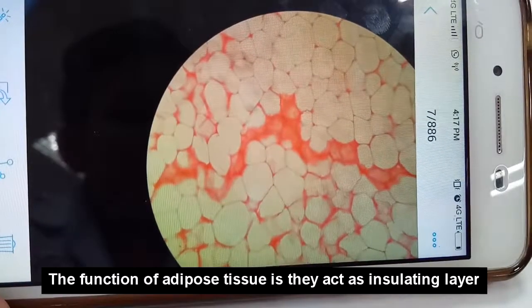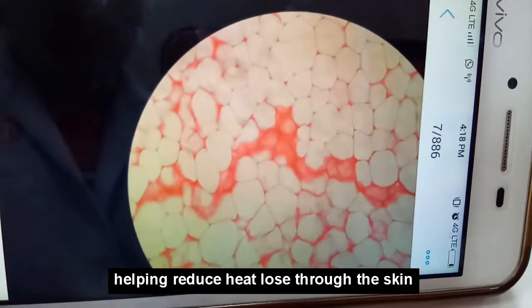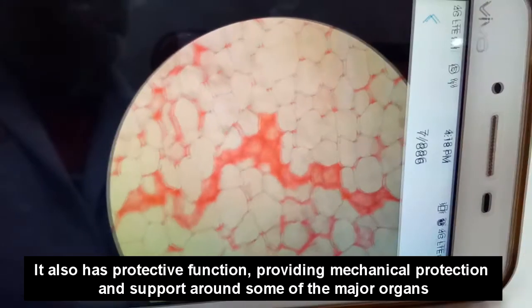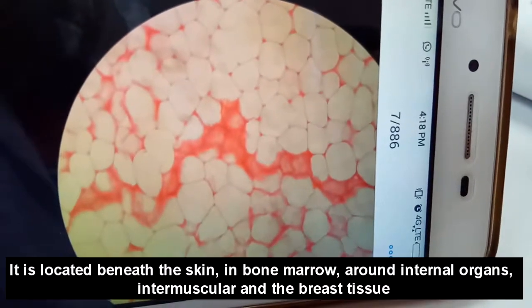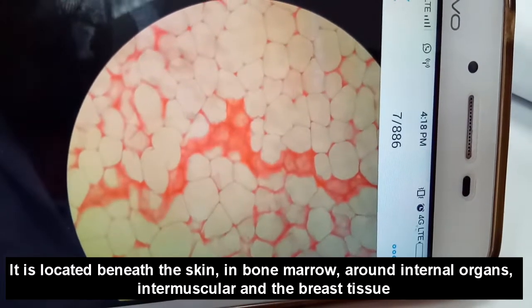The function of adipose is that it acts as an insulating layer, helping to reduce heat loss through the skin. It also has a protective function, providing mechanical protection and support around some of the major organs. It's located beneath the skin, in bone marrow, around internal organs, intermuscular, and also in the breast tissue.